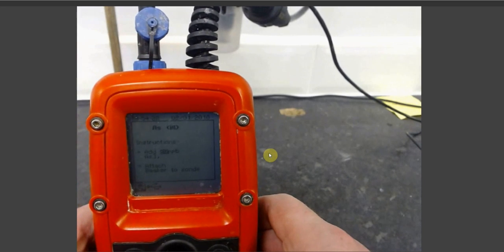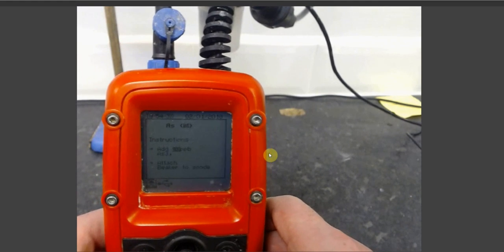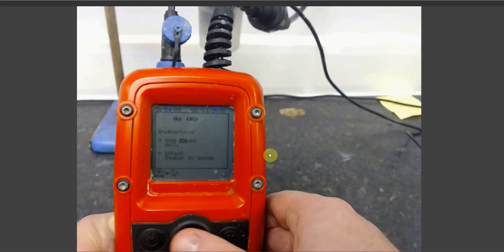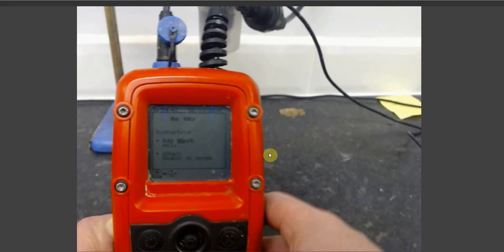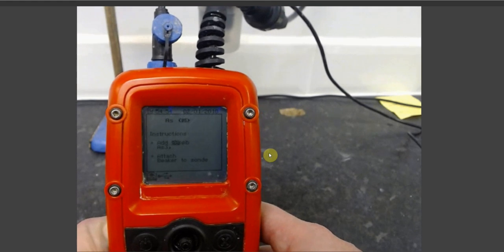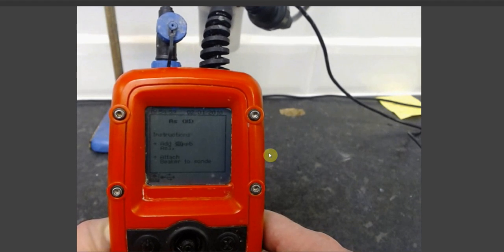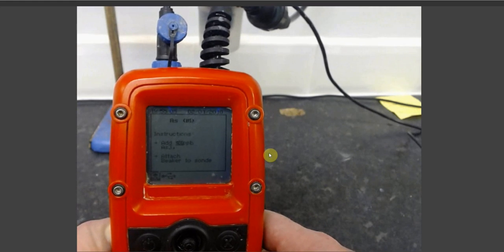Once your Metalyser has completed its first analysis, it will prompt you to make a standard addition of 20 parts per billion. You can change the concentration of your standard addition by pressing sideways on the trackpad of the Metalyser. If you have historical data, or if you have an expected concentration, then you should match your standard addition to this expected concentration as a matter of best practice.